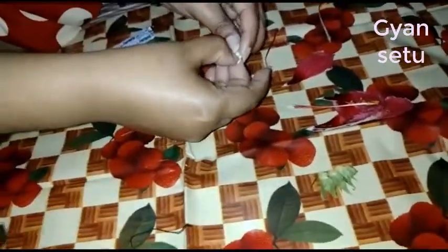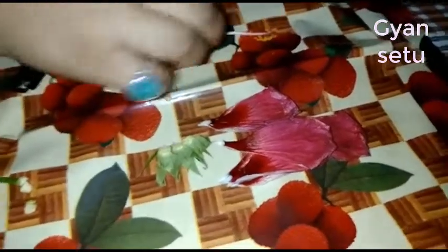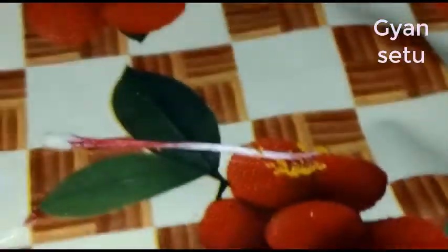This is the basic introduction about the flower. After this, you will learn about how the flower helps in reproduction and how a flower gets maturity. You have to paste these parts in your notebook separately and name them — sepals, stalk, ovary — and repeat this section and paste it in your biology notebook. Thank you.